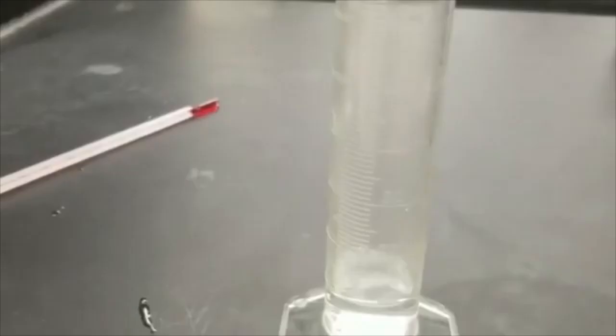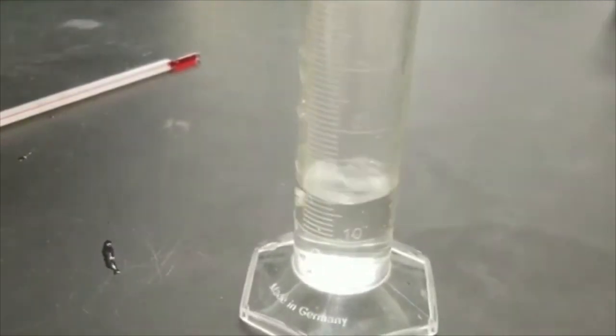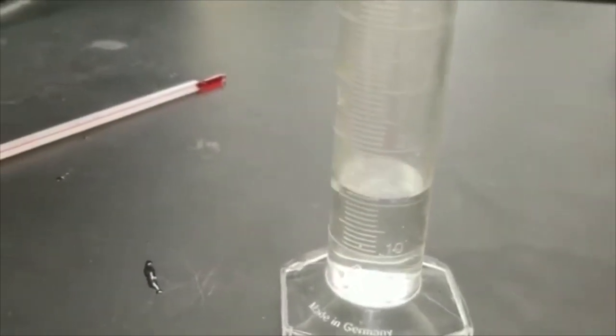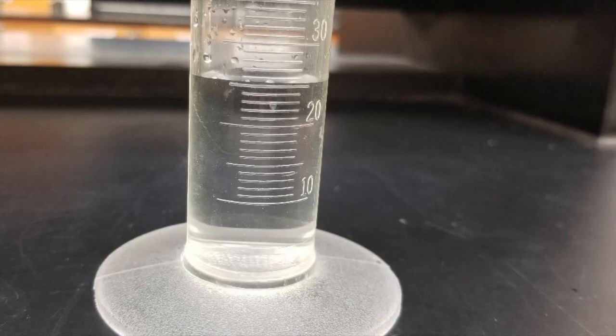From the beaker, pour approximately 20 to 25 milliliters of water and read the volume to the appropriate number of significant figures.